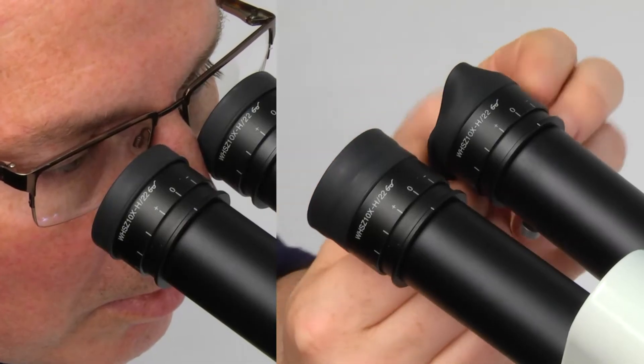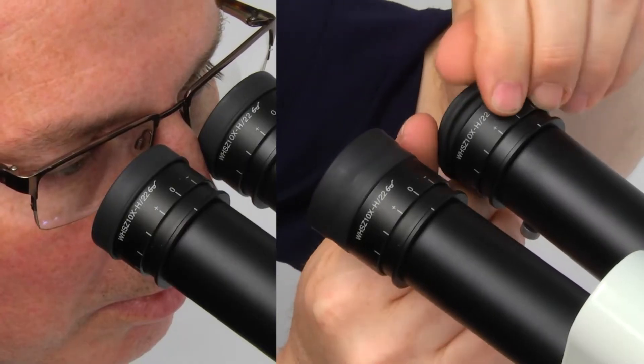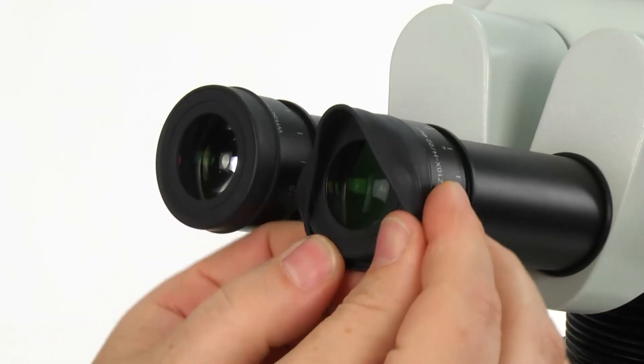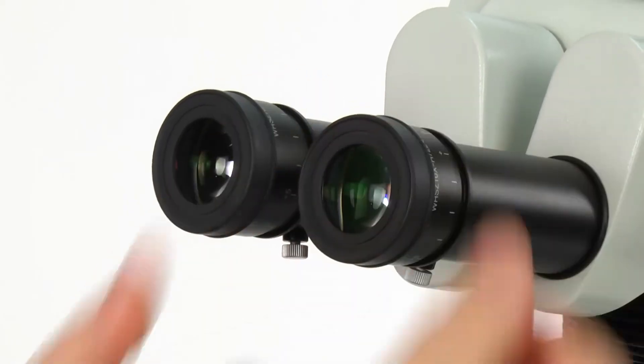For operators who wear glasses, Olympus recommends using the eyeshades in the normal fold down position to help prevent eyeglasses from being scratched.